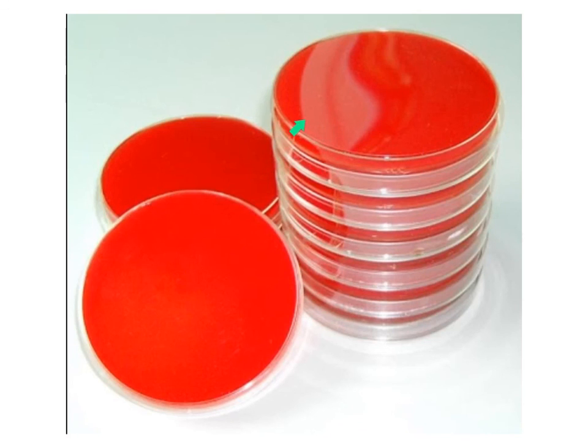The date is important for us to know the age of the bacteria, and then obviously we want to know what is growing on the plate, and for you to be able to find your plate within the group.